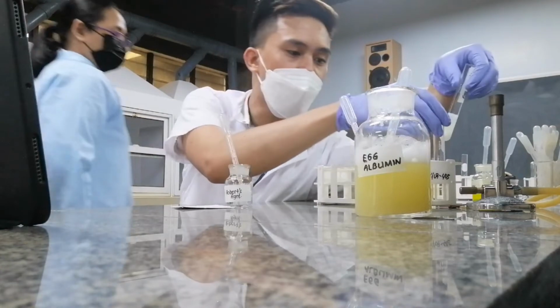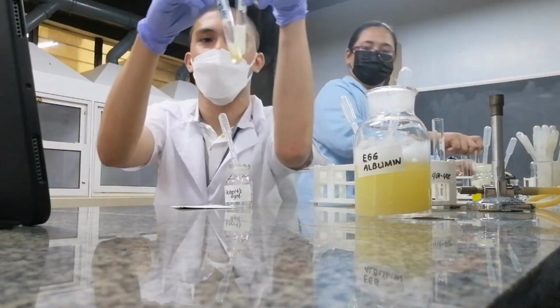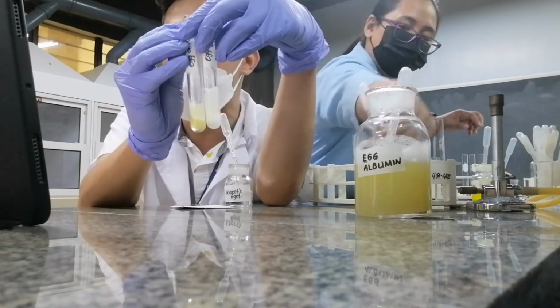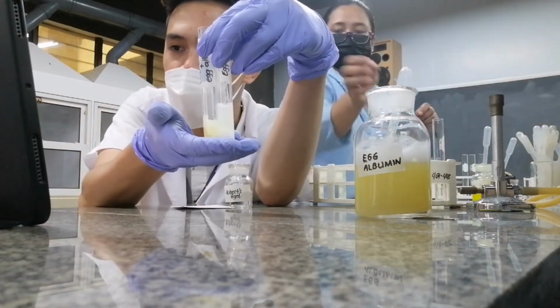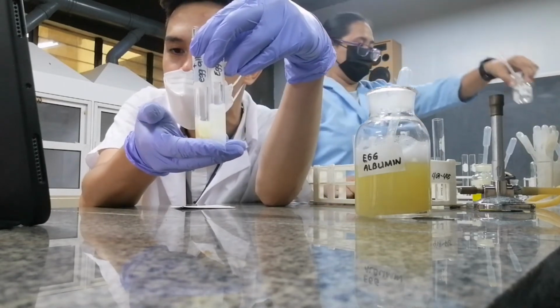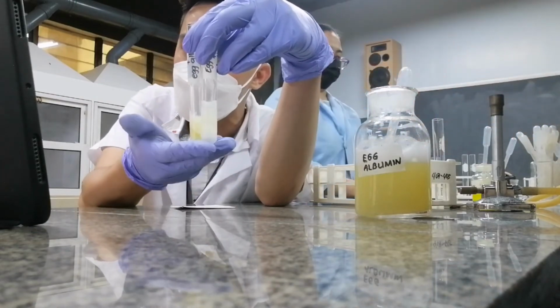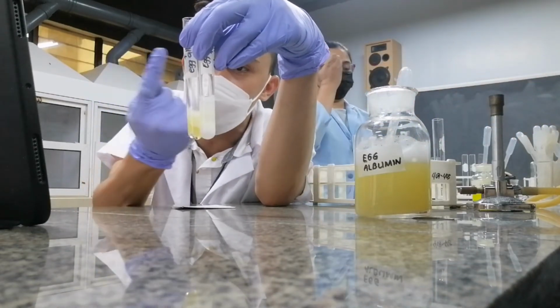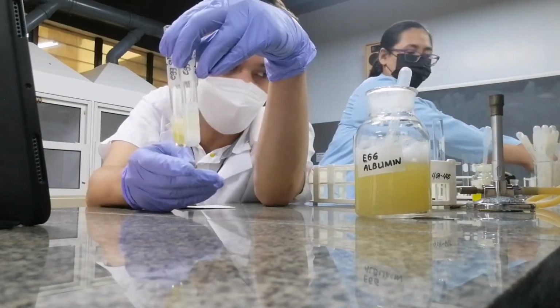Alright. So therefore, what is the effect of your mineral acids, class? They're able to produce rings. So what is the ring? Is it a precipitate or a coagulum? It's a precipitate. Do you follow? The formation of the ring is actually an indication that it's a precipitate.